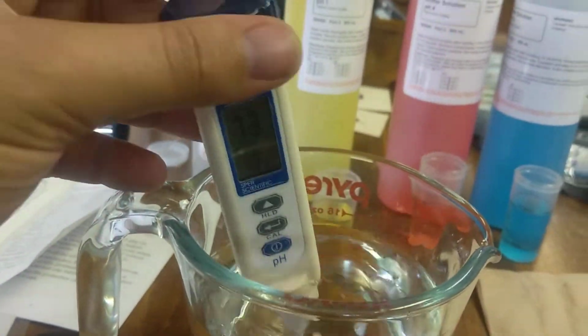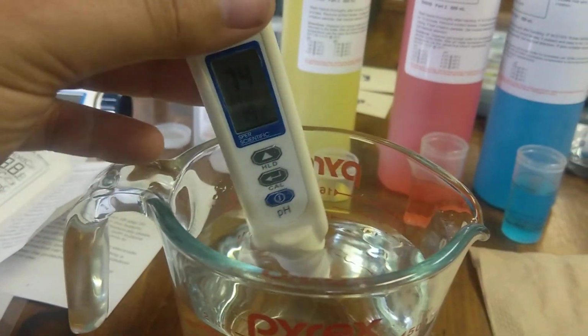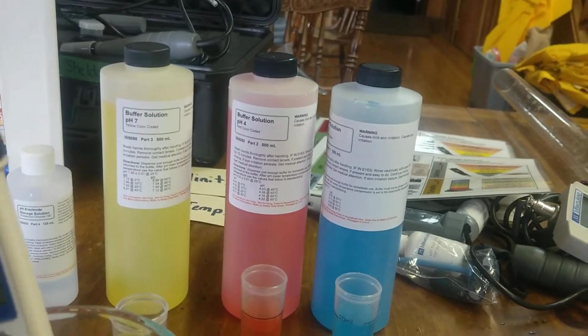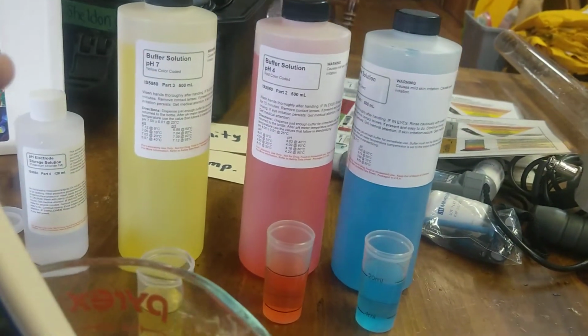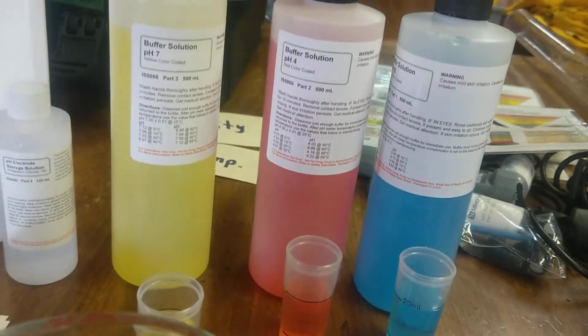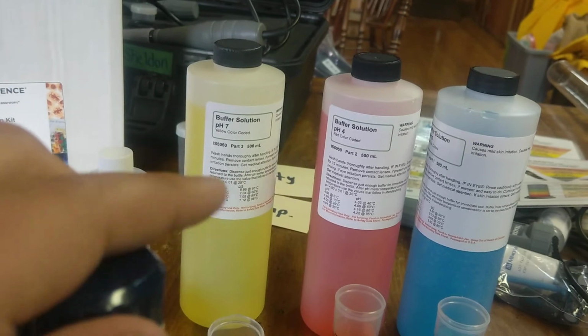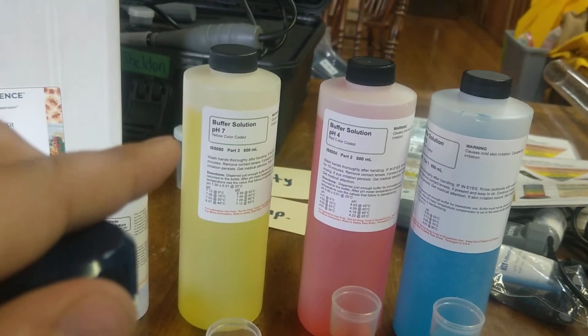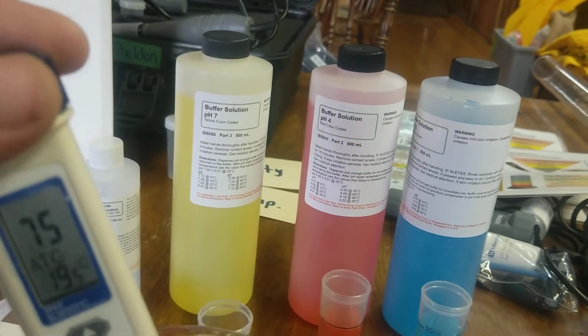And after you do that, you can just store it back with the cap if you're just doing a one point. If you want to make it a little more accurate, you can go through the other buffer solutions. We have a pH 4 and a pH 10 buffer solution here. I like to do it by color here, go from lightest to darkest. You always start off with pH 7, and you can just do that.